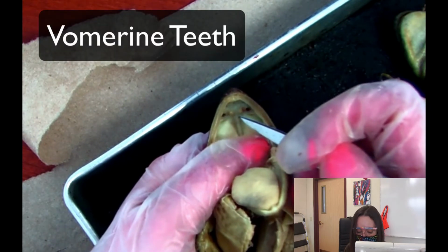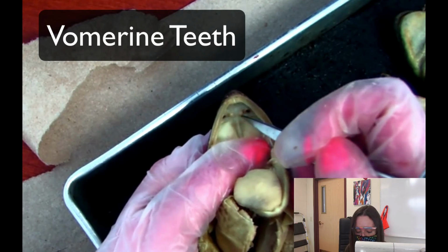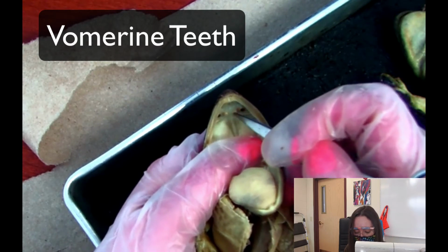Okay, so you got the vomerine teeth. No, not Mr. Vollmer teeth. Anytime I say this, students always think of Mr. Vollmer. But these are the vomerine teeth.